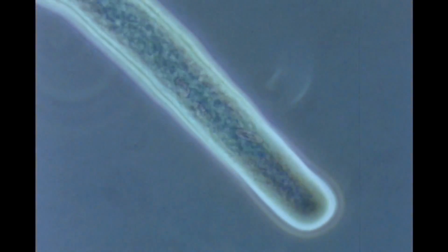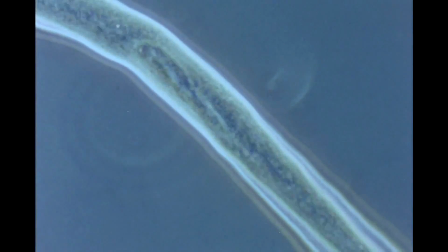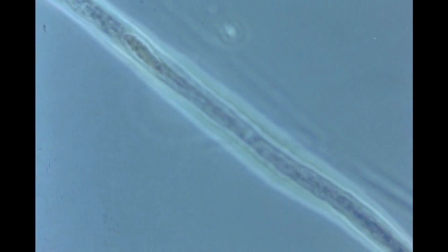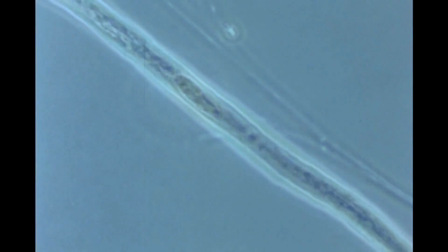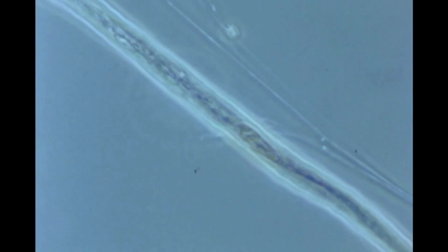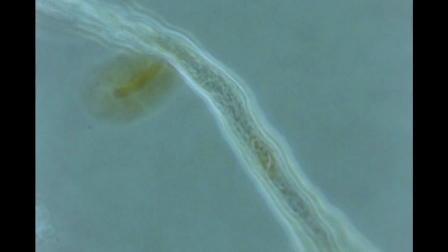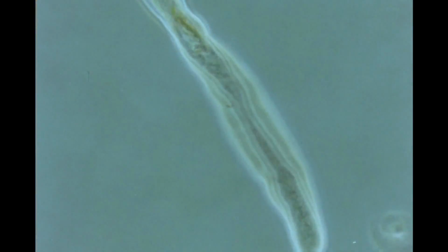The tube grows very rapidly at rates greater than 500 microns per hour. Growth of the pollen tube is restricted to a zone of about 5 microns at the tip. The pollen tube, like the root hair, grows only at its tip, unlike most plant cells, which grow over their entire surface. During germination and growth of the pollen tube, the cytoplasm streams very actively.